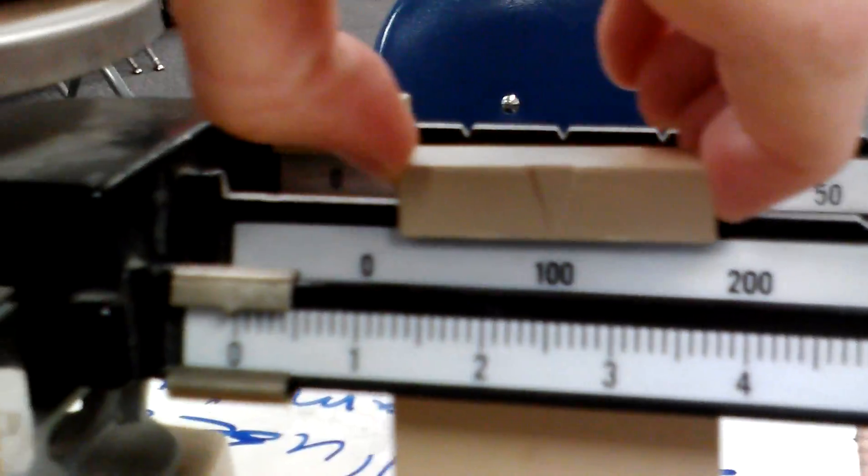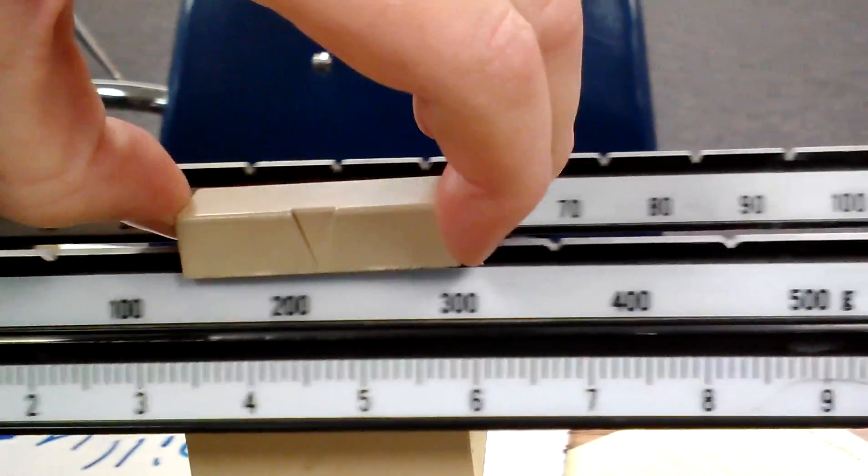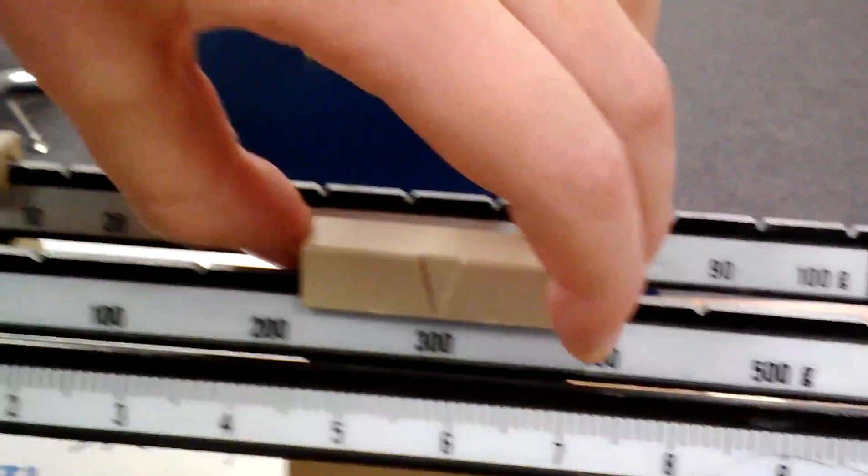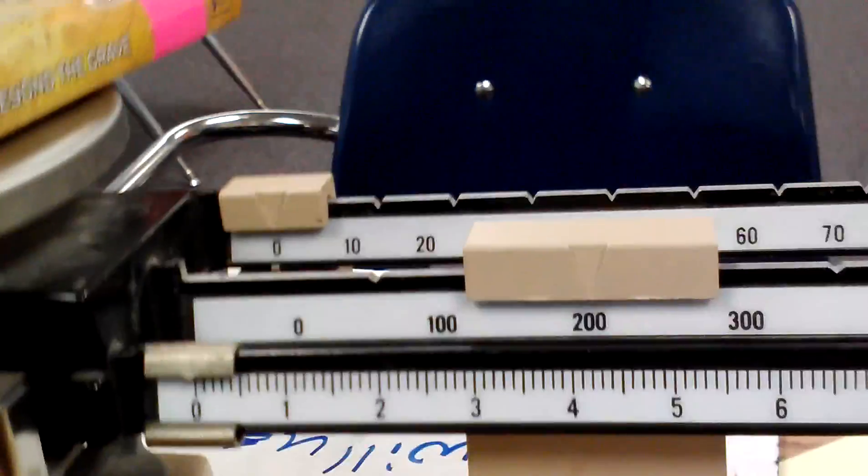Okay, so probably want to start from 100, 200. 300 is a bit too much, so you go back to 200. And that's as far as it can go.